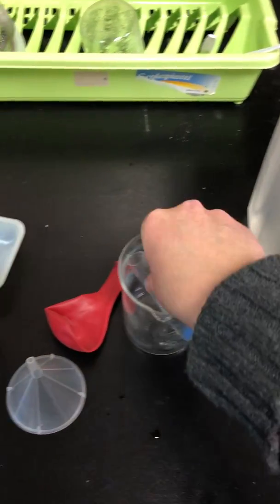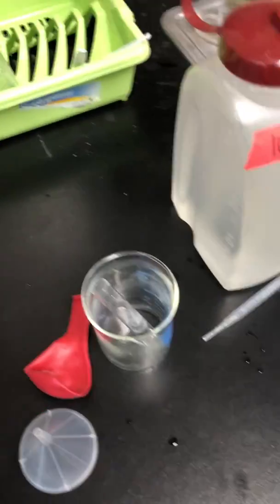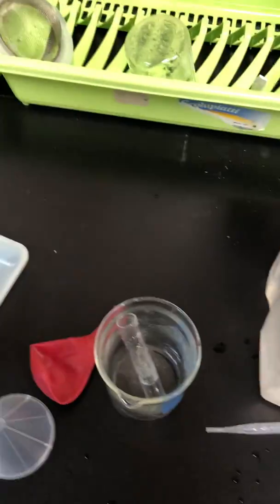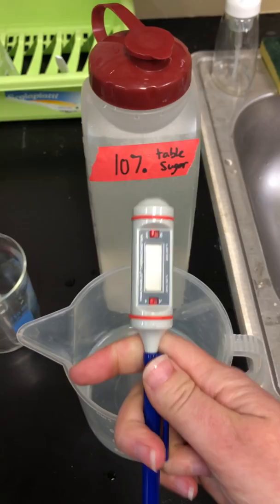So once I filled up my 2 test tubes, I need to do this once with sugar water. And I'm interested in testing different types of sugar, so I would do the same thing with the potato starch, but I won't do that for the demonstration. And I need to make sure that this water is the right temperature. So I will have hot water back here. We will have a thermometer going.